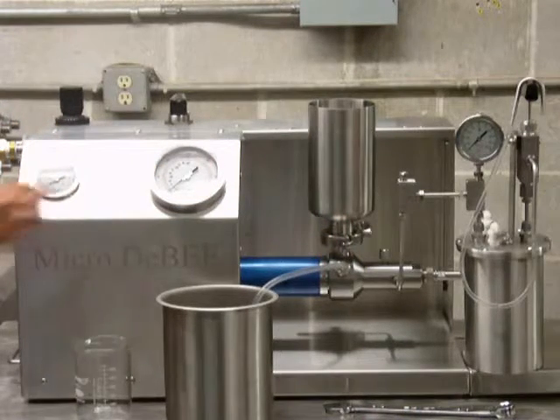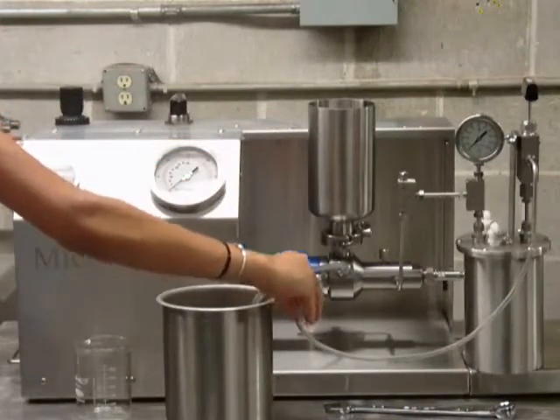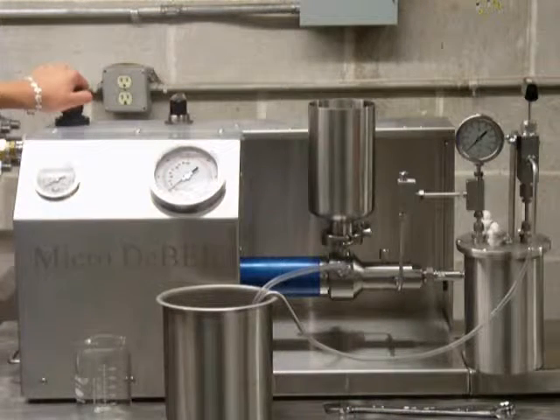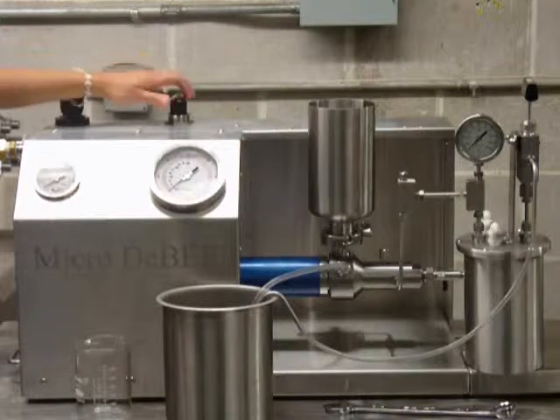You then want to place the open ends of the two discharge tubes into a suitable container. Then, turn the air regulator clockwise until the air pressure is at 10 psi. After doing this, turn the on-off valve to the on position.